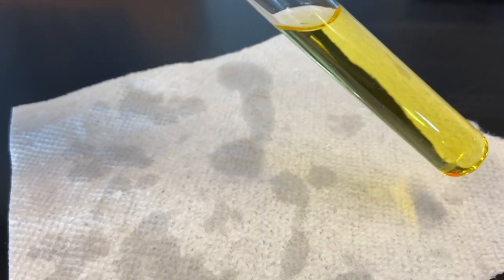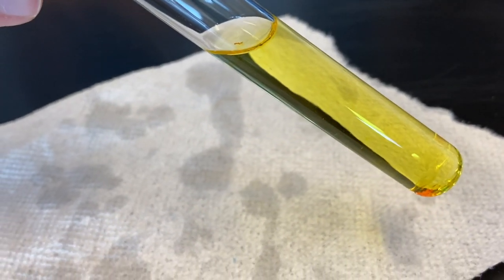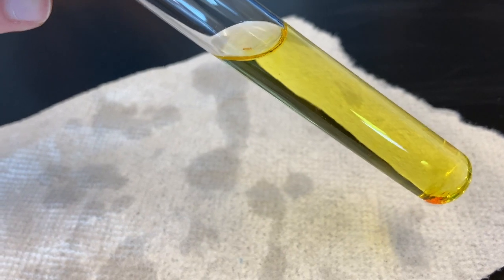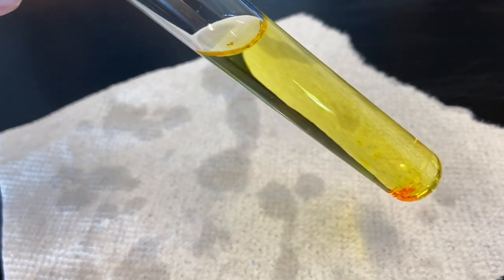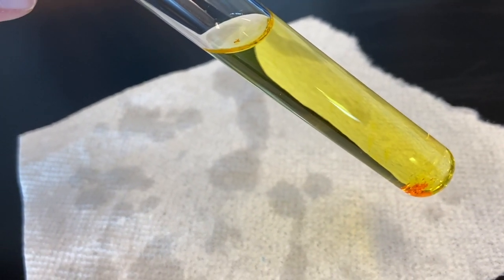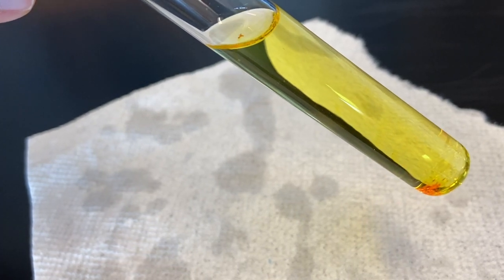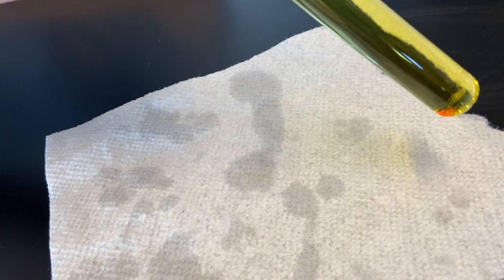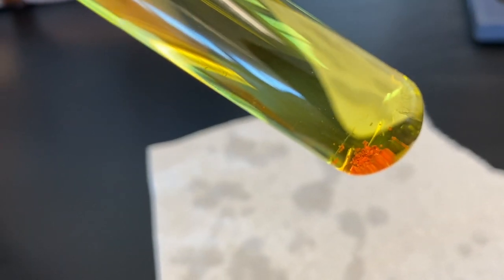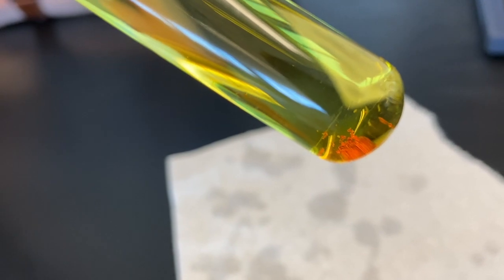Okay, so you notice a difference. Make your observations in the observations after section, and then identify the type of change that you see. Also notice the bottom — you might see that there are still a few of those crystals present.